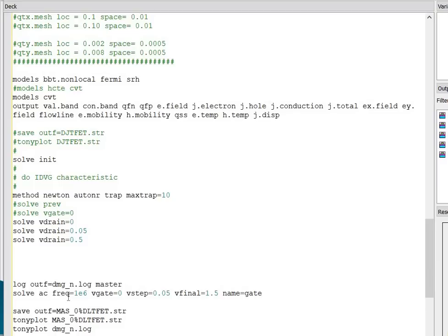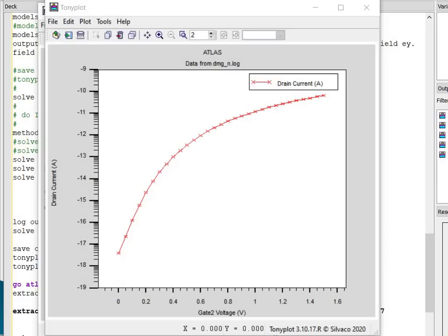Next, apply this command to find out the conductance and the capacitance in the device. And the last one, you have to save the log file and the structure file, and you can view the log file and the structure file in Tonyplot. When you run the program you will find the log file, this one.